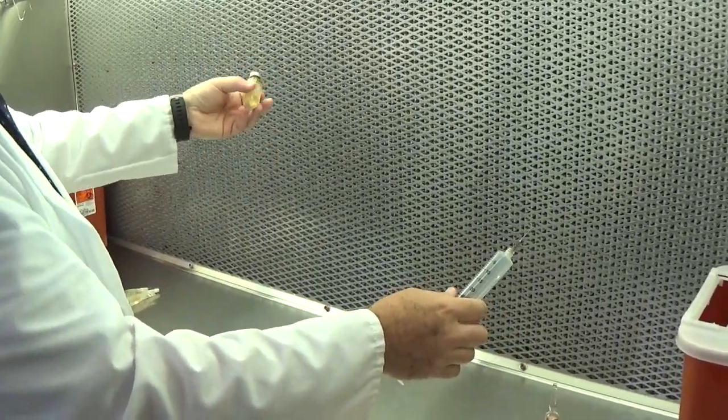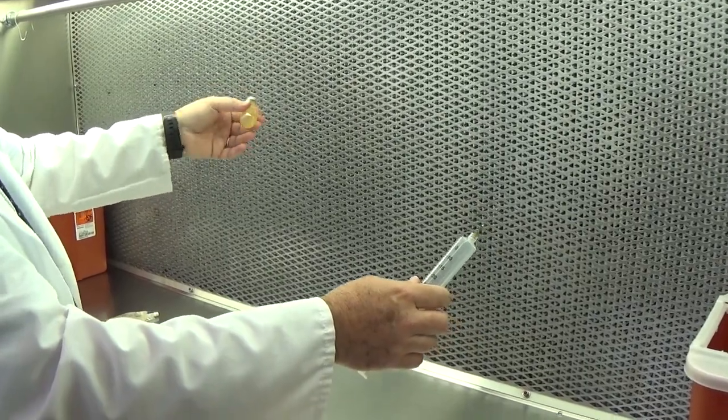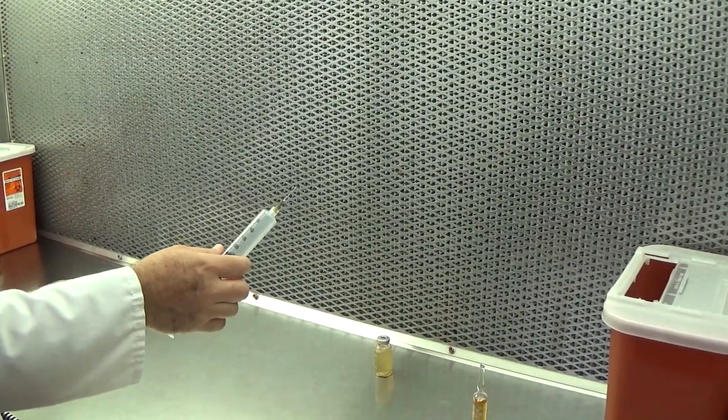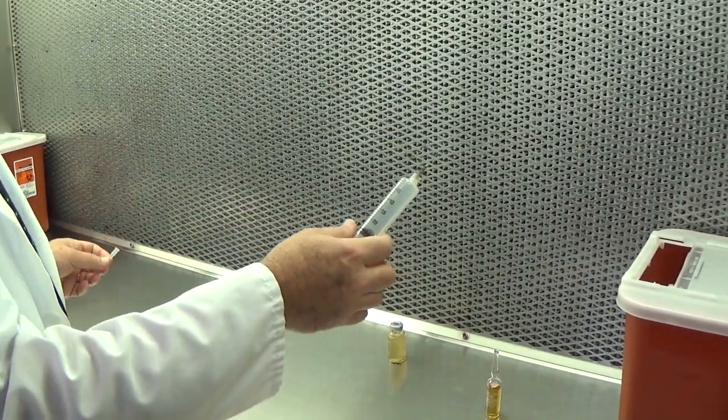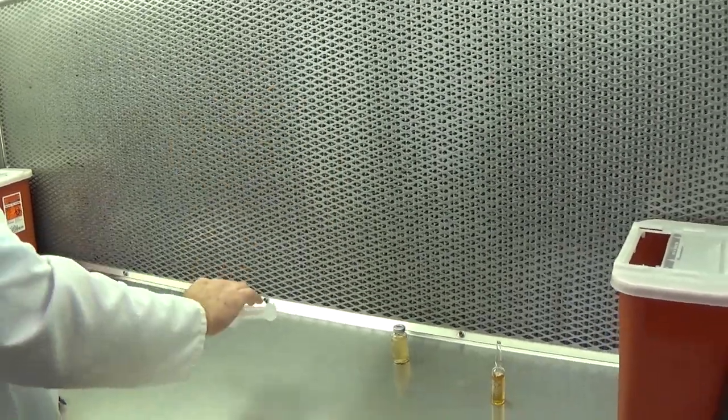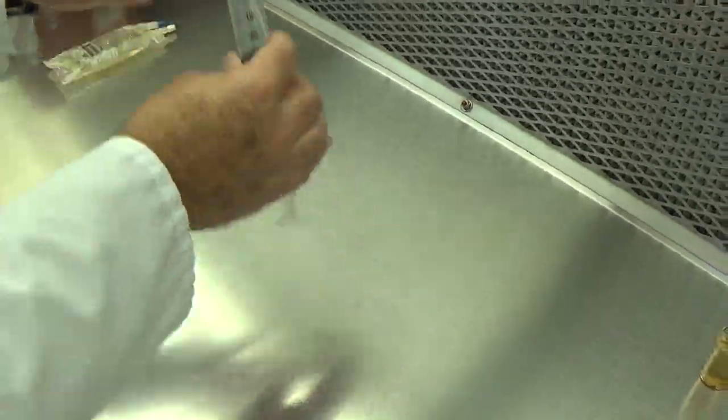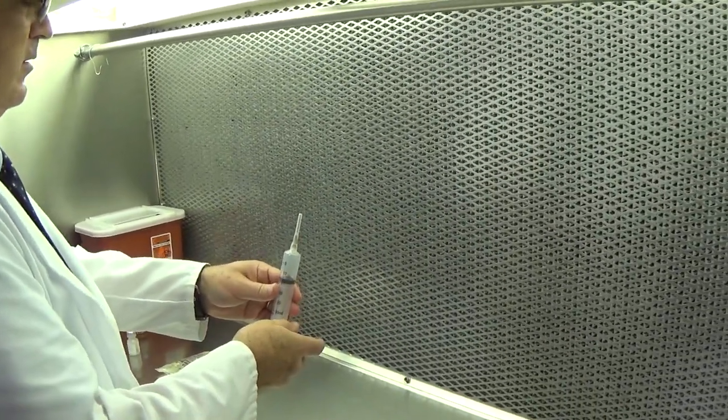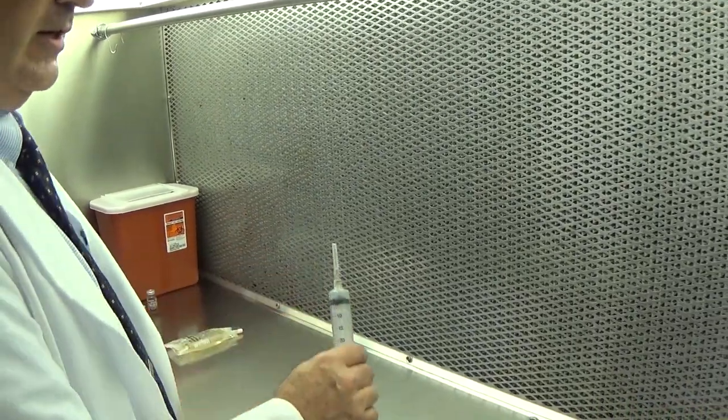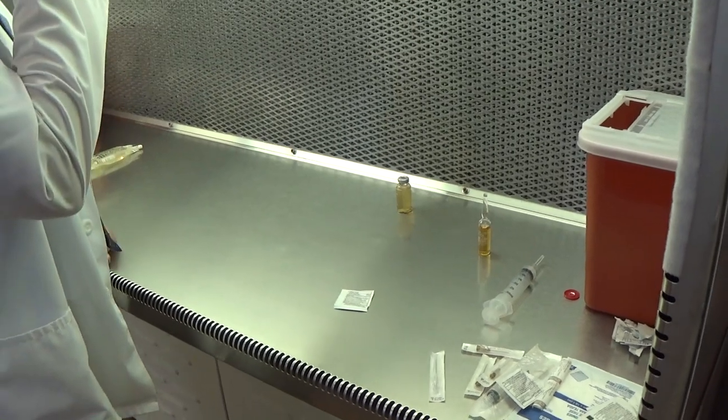And unfortunately, this particular powder takes a while to dissolve, so I'm going to set it to the side for further reconstitution. This is one case where I do want to recap my needle. I'm going to use the one hand scoop technique, so not to stick myself. I could easily use another syringe and needle in a few moments, but in interest of economy, I'm going to use the same one.